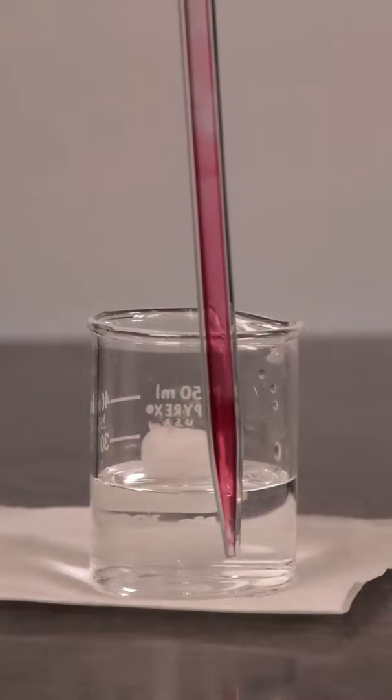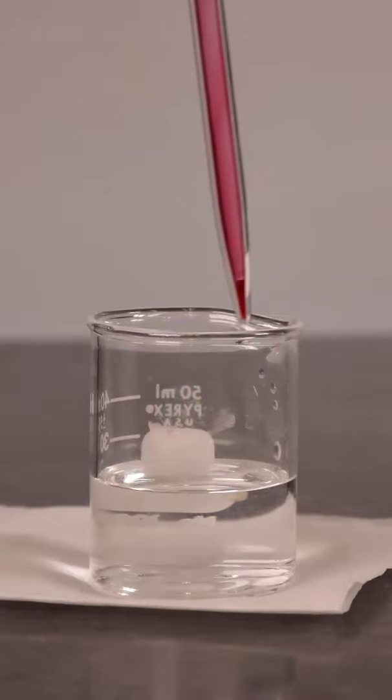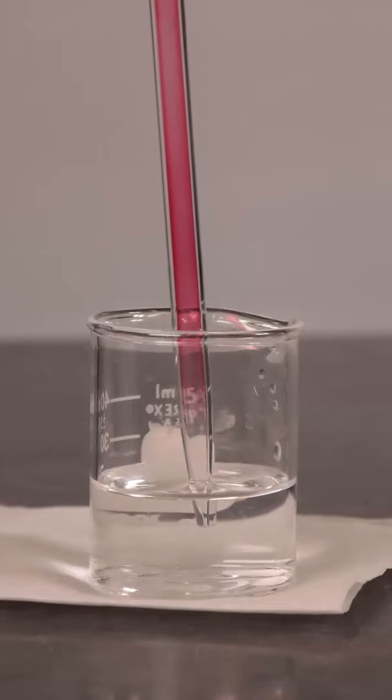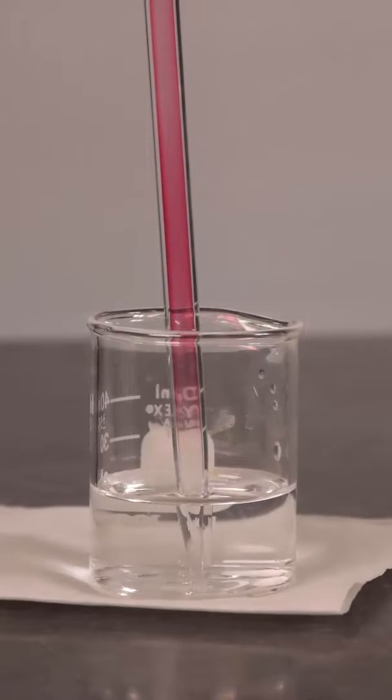Notice in this example how air is drawn into the pipette before being placed into the rinsing water. Here you can see the gradient of water entering the pipette.